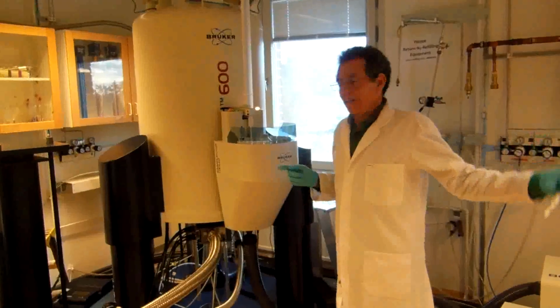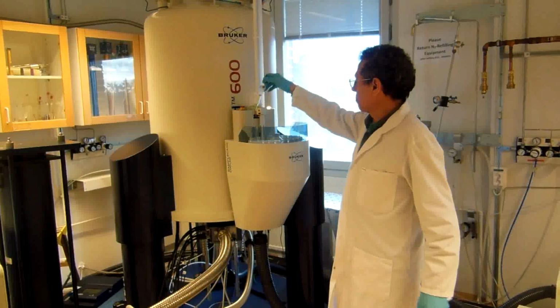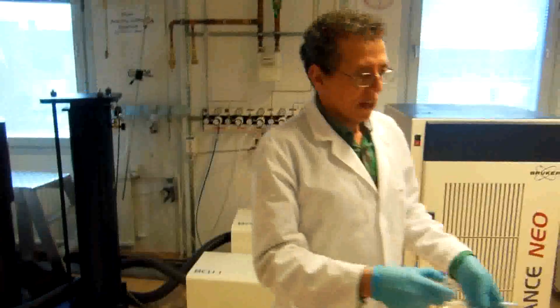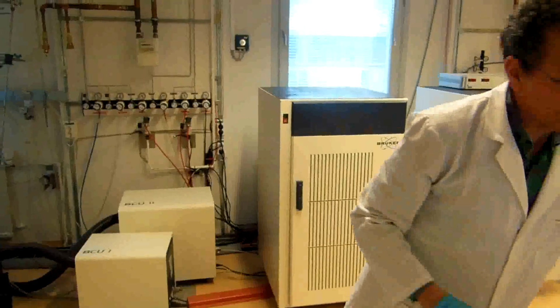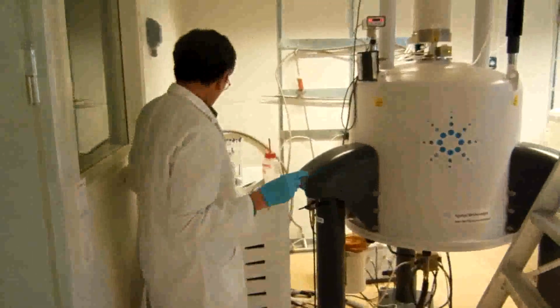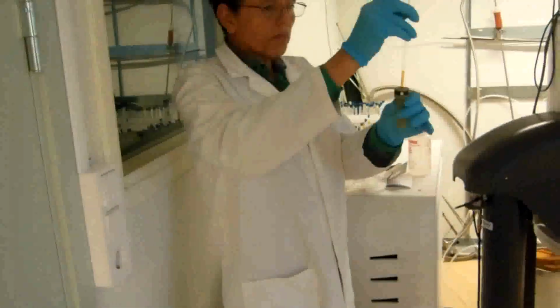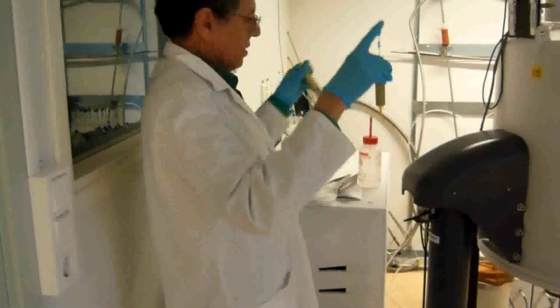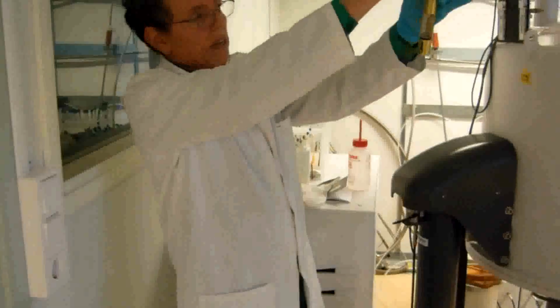Since the 500 and 600 machines are both busy now, I will do the analysis in the 400 machine, and I will show you how to do it quickly. So again, you control the size by using this one. I use this. Okay.